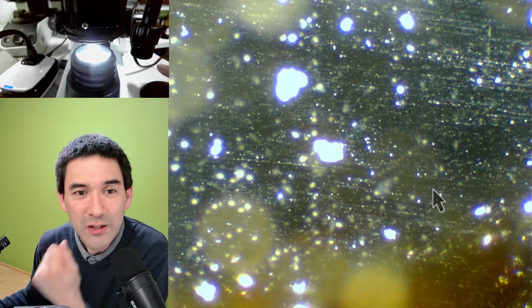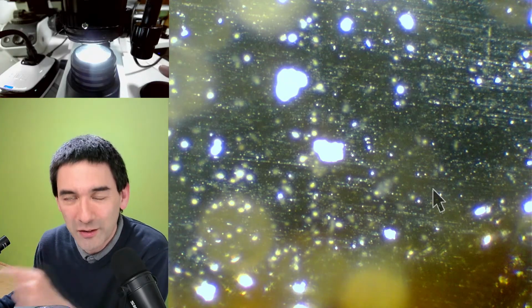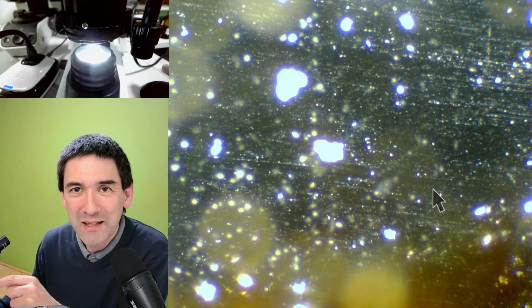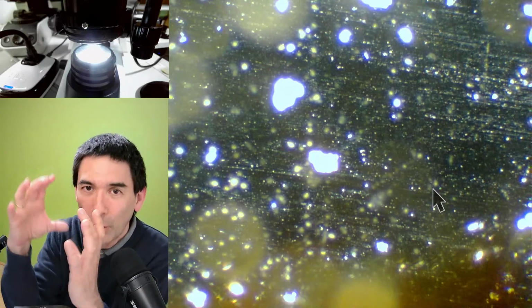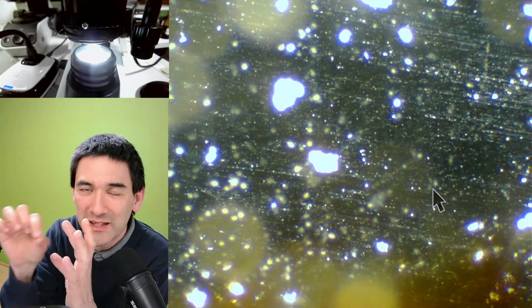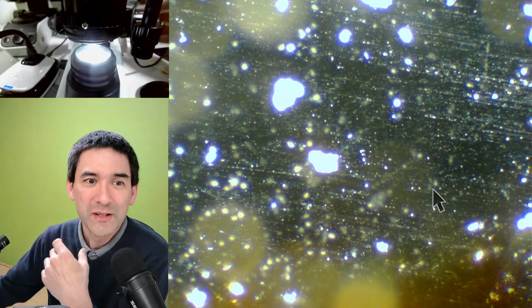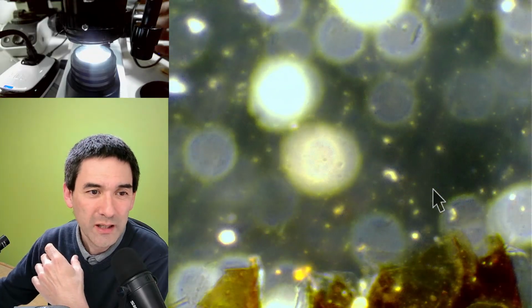So that's kind of interesting, because you're actually able to see things that are smaller than the resolution limit, but you're still not violating the laws of physics because you're just seeing a larger blob. But the actual structure is smaller. So it's a little bit like when you go over here and now it's out of focus. Maybe I'm just going to turn it the other way, something like this.